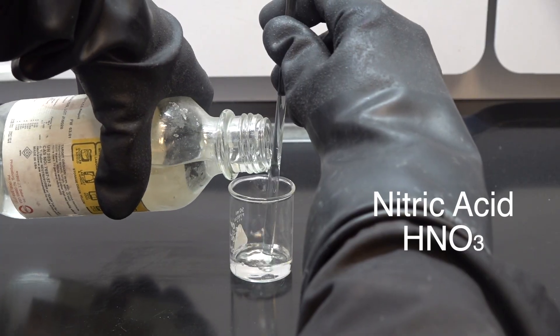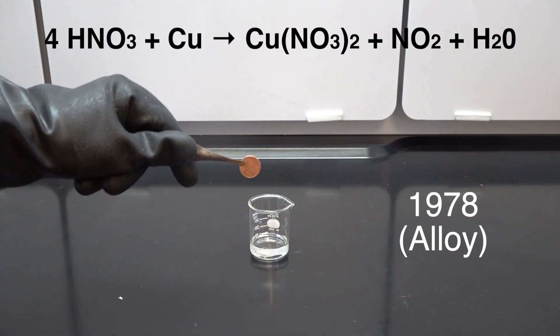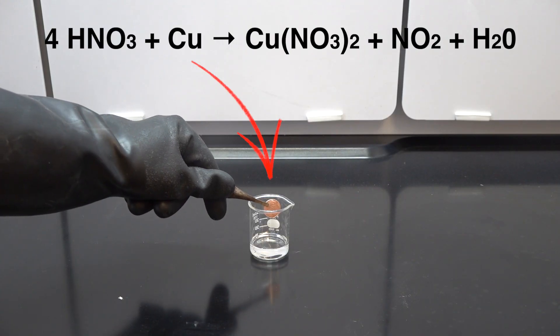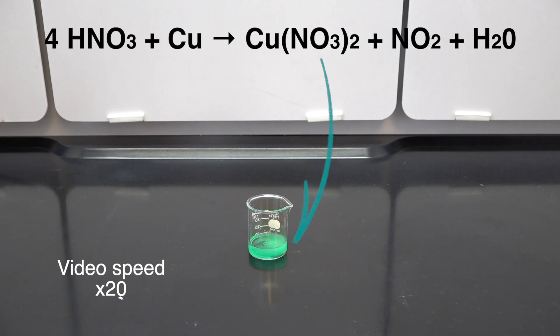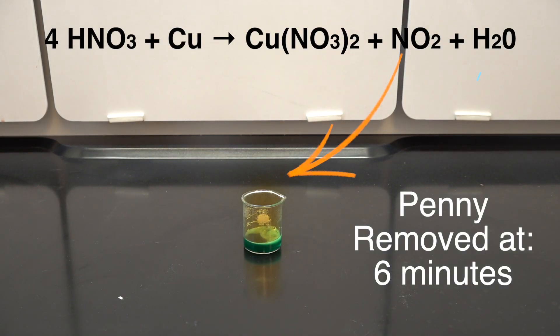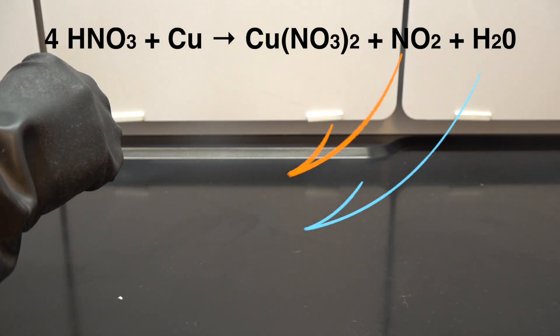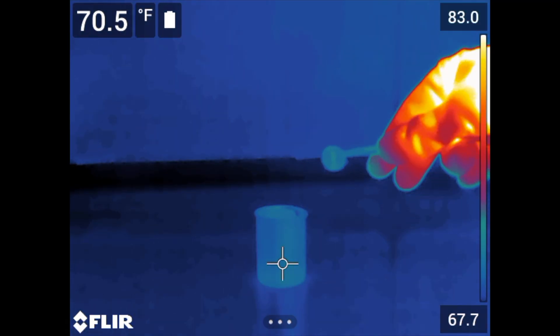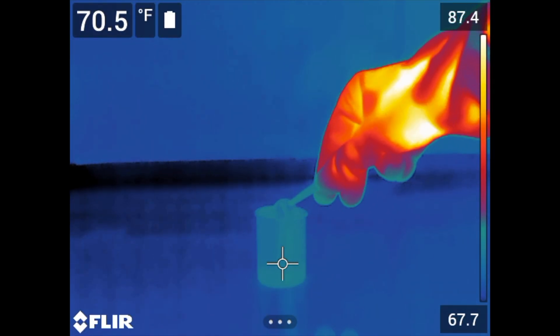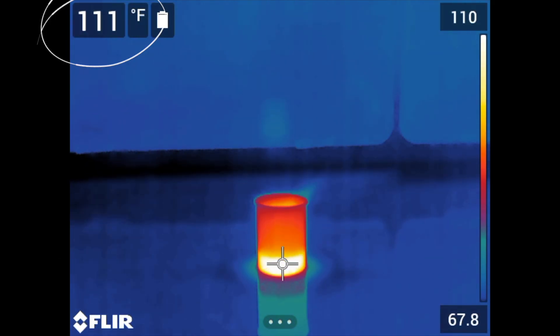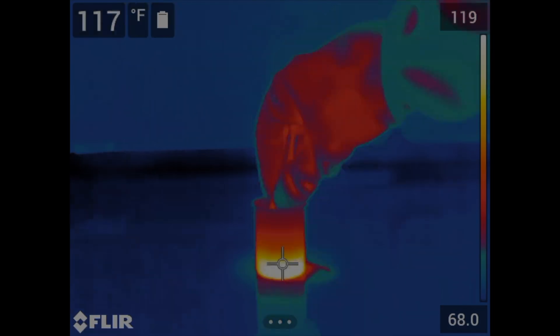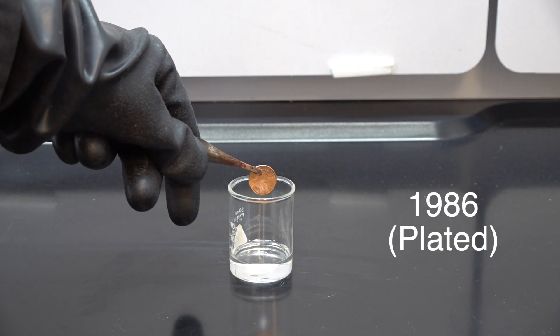I'm going to use some concentrated nitric acid. I'm doing this in the fume hood because this stuff is nasty. The first one here, we're going to drop the copper into that nitric acid and you're going to see a reaction start very quickly. What's being left behind is copper nitrate. It's the copper ions that are coming out of there. That brownish orange gas, that's nitrogen dioxide. That stuff is brutal. That's why you need to do that in a fume hood. This is a highly exothermic reaction. So if you look up there, we start at about 70 degrees. We get all the way up to 120 degrees Fahrenheit as this reaction is going on. I mean, that's pretty wild. That shows you just how exothermic it is.